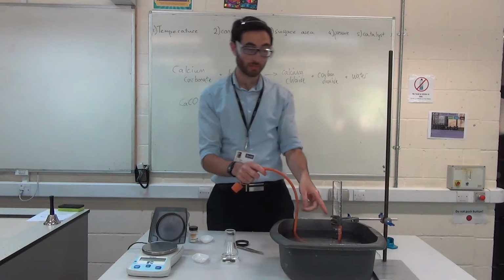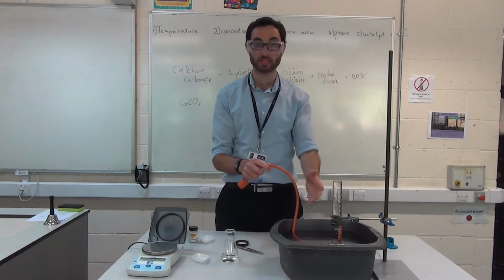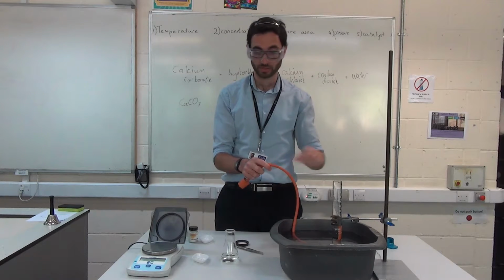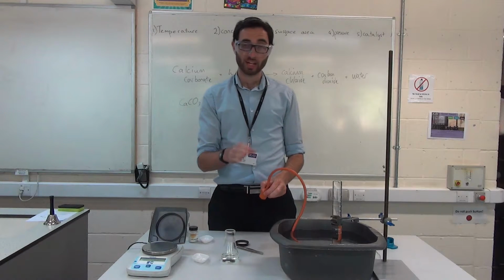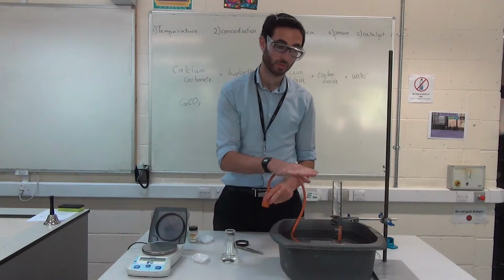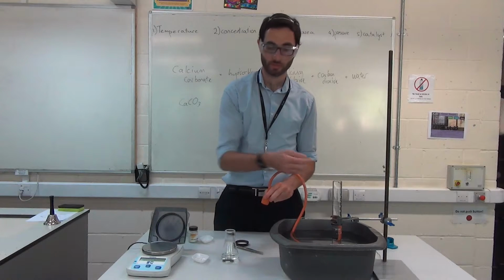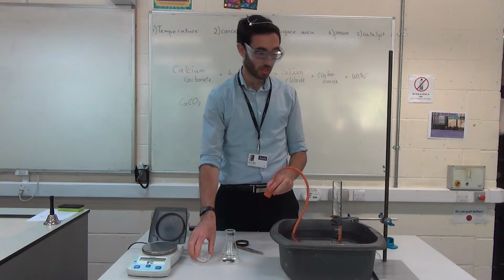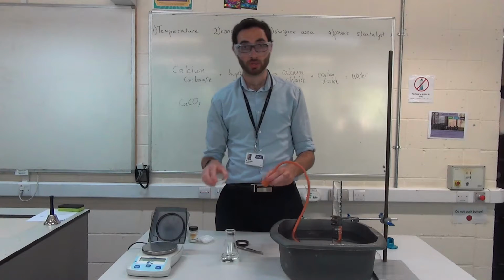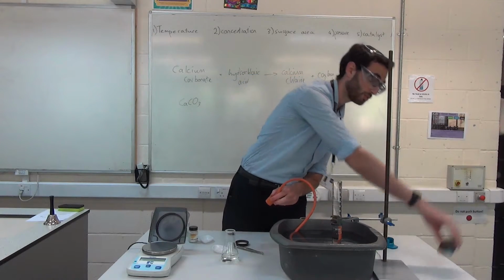If the tube is not in the measuring cylinder, you don't get the gas that you wanted. It just goes off into the atmosphere, bubbles through the water instead of going into here. Similarly, another problem that you often see with this is if there's a gap here. It needs to be completely full with water, there needs to be basically no air there at all, otherwise you get an inaccurate measurement. So, I'll be doing this with a partner, and I would ask them to hit the stopwatch as soon as I started the reaction, and I'm going to ask Mr. Orr to hit that for me.